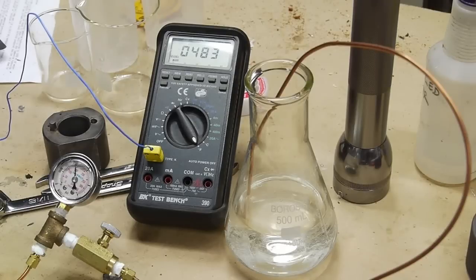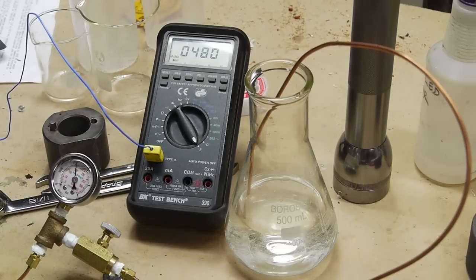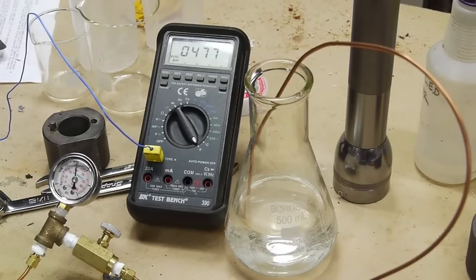Once the pressure is below the critical point, about 1200, and the temperature is still above 460, we can start venting the chamber more quickly because we know that there's just gas inside there. All of the supercritical drying has occurred.